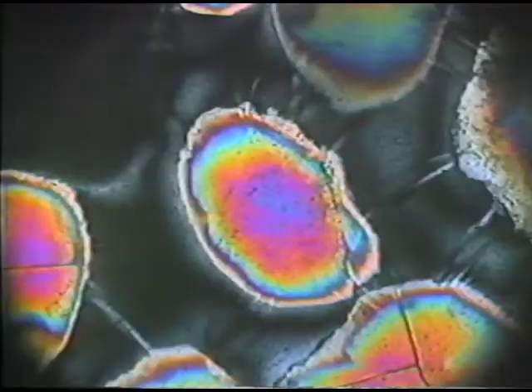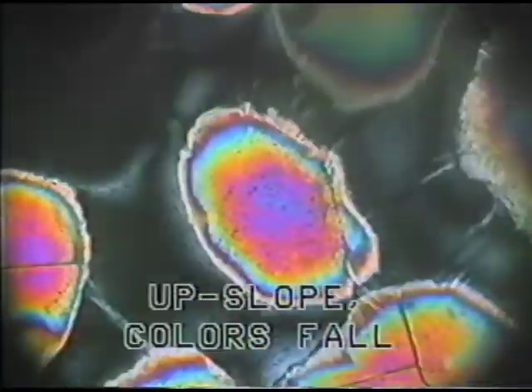for this particular grain, are moving up slope. The colors move from the outside of the grain toward the center of the grain. Okay, the interference colors move from the outside toward the center of the grain as I am inserting the quartz wedge. And now I'll insert the quartz wedge again, and you can see that the colors are sliding in, moving up slope. In this kind of situation where the colors move up slope, we say that the colors are falling. This means that the quartz wedge, the slow direction in the quartz wedge, is opposed to the slow direction in this particular grain.